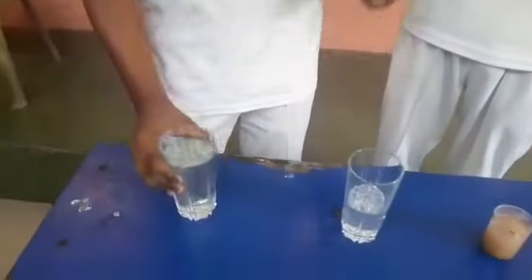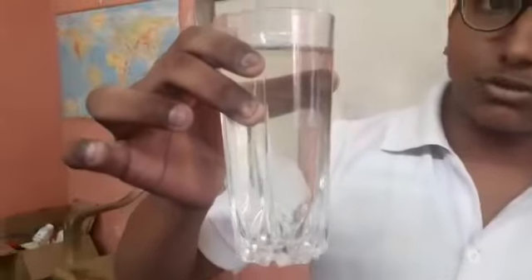Let us distinguish them on the basis of transparency. This is a sugar solution — we can see through it. This is a soap and water solution — we can see a little bit through it. This is a sand and water mixture — we cannot see through it.